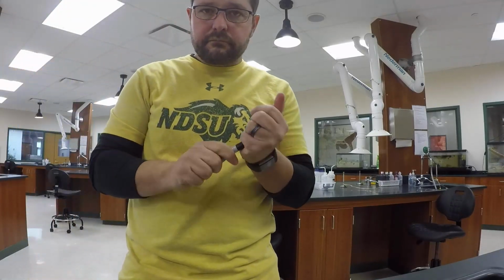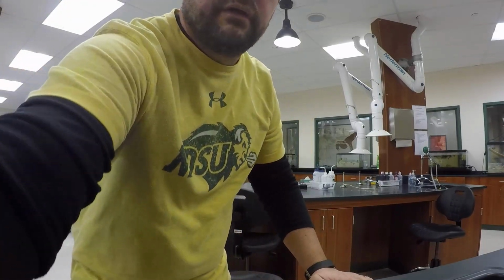Okay. All right. I'm going to do one more off camera, just to save your guys' sanity. So I'm going to choose one more thing to inoculate. Then I'll come back and I'll show you how to do the throat and the nose.